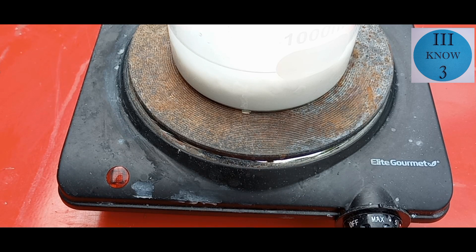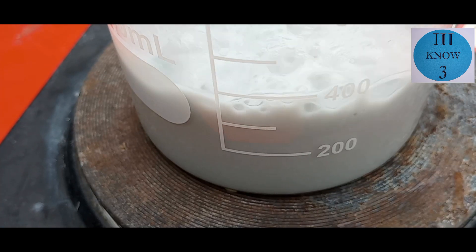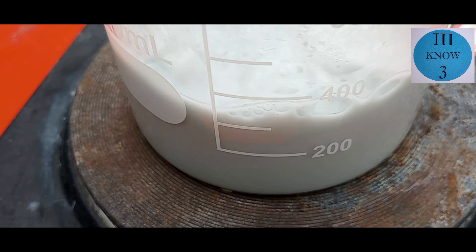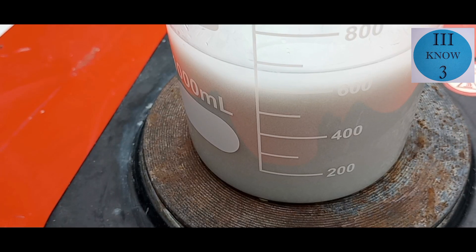After coming to a boil, it maintained its milky appearance, so I thought I would add some more water to see if it was saturated. And then even more water, but it still looks like a neurotoxic milkshake.